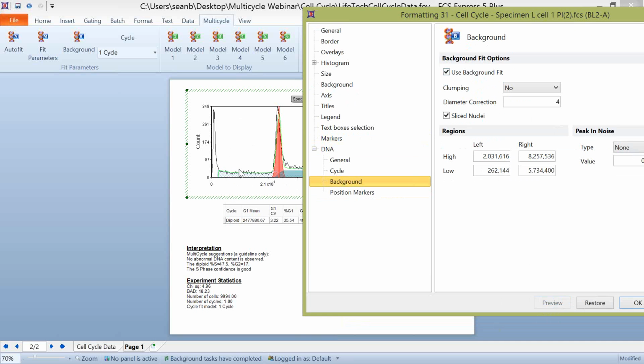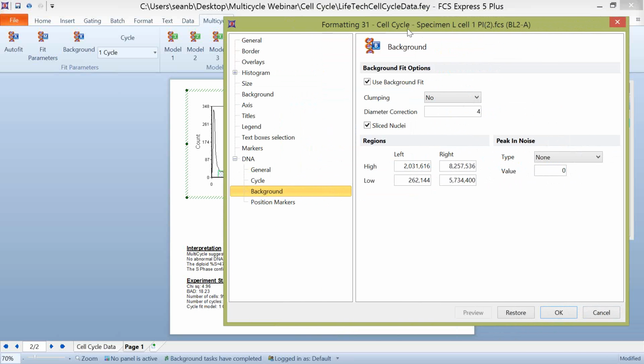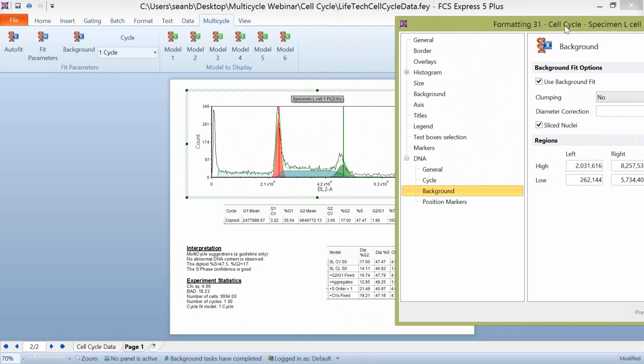So, if you do have background data and you've decided not to use either doublet discrimination or you're including a little bit more in your scatter gate than you would have expected, using the background fit is a great way to correct for some of these things. You notice that the background doesn't just subtract from what's prior to the G1 peak, it's doing some subtractions all the way across S phase and G2. So it's a very sophisticated way of analyzing this data. It uses some clumping algorithms. You can do corrections for the diameter of what's used in that background fit, as well as using a sliced or unsliced nuclei way to fit that background.